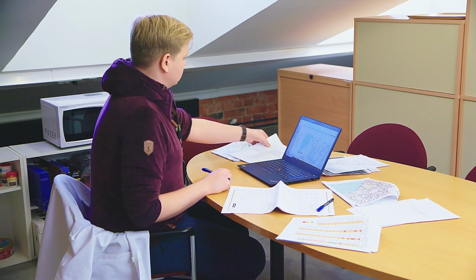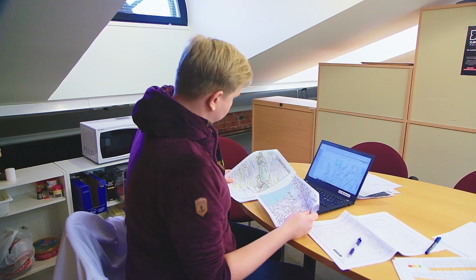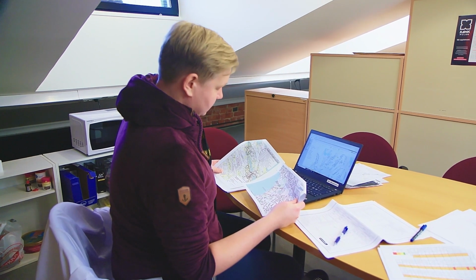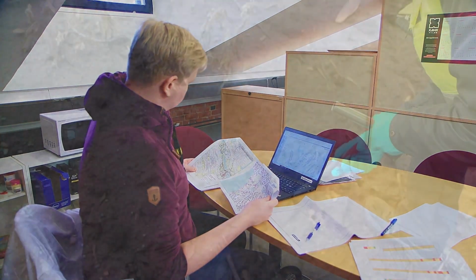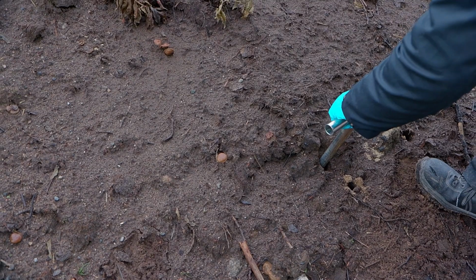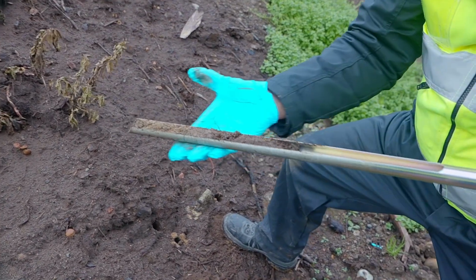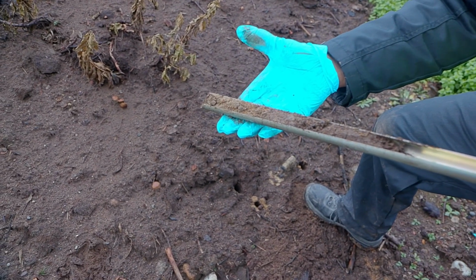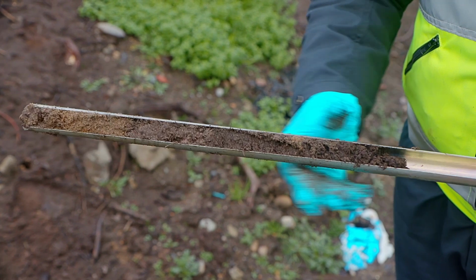There are several methods for soil sampling, and their suitability should always be considered based on the properties of the soil and the contaminant. Typical sampling methods include, for example, excavation of ground, that is, digging trial pits, mechanical or manual sounding or boring, taking samples from soil piles or windrows, or digging directly from the topsoil.